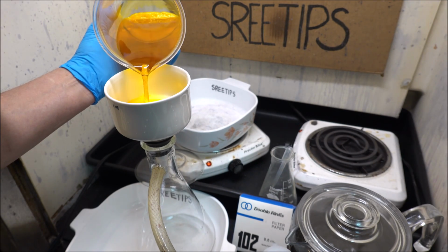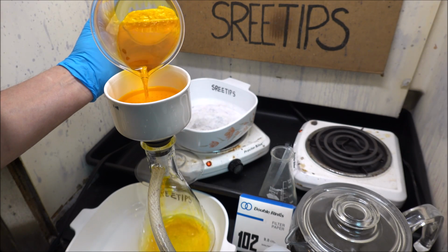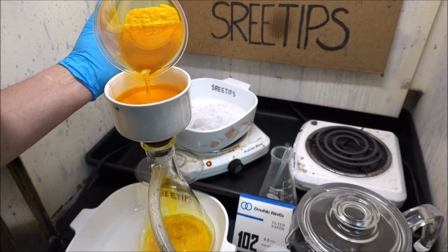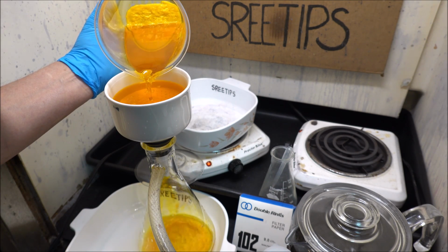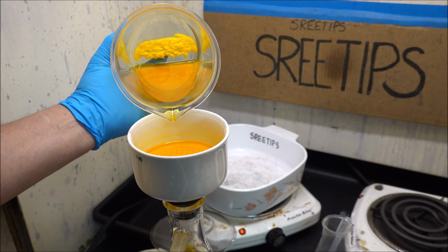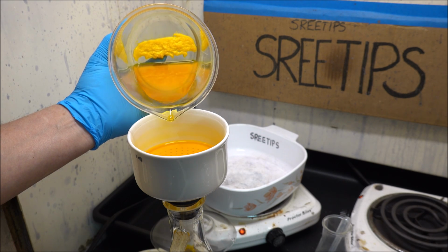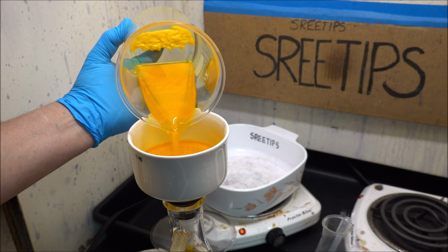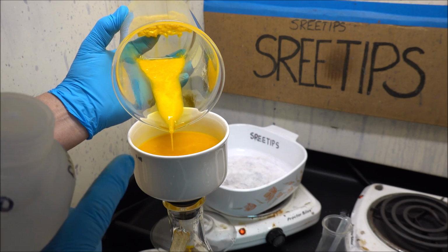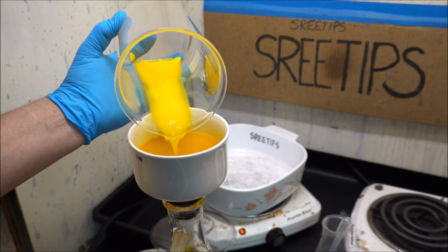Notice how the filter paper helps me here down in the bottom of that beaker by retaining any solid material, allowing me to pour off the clear solution into the filter. And now what I'm going to do is pour the solids in here and get the rest of the solution off of these solids. This is going to load the filter paper up and slow the filtering way down.